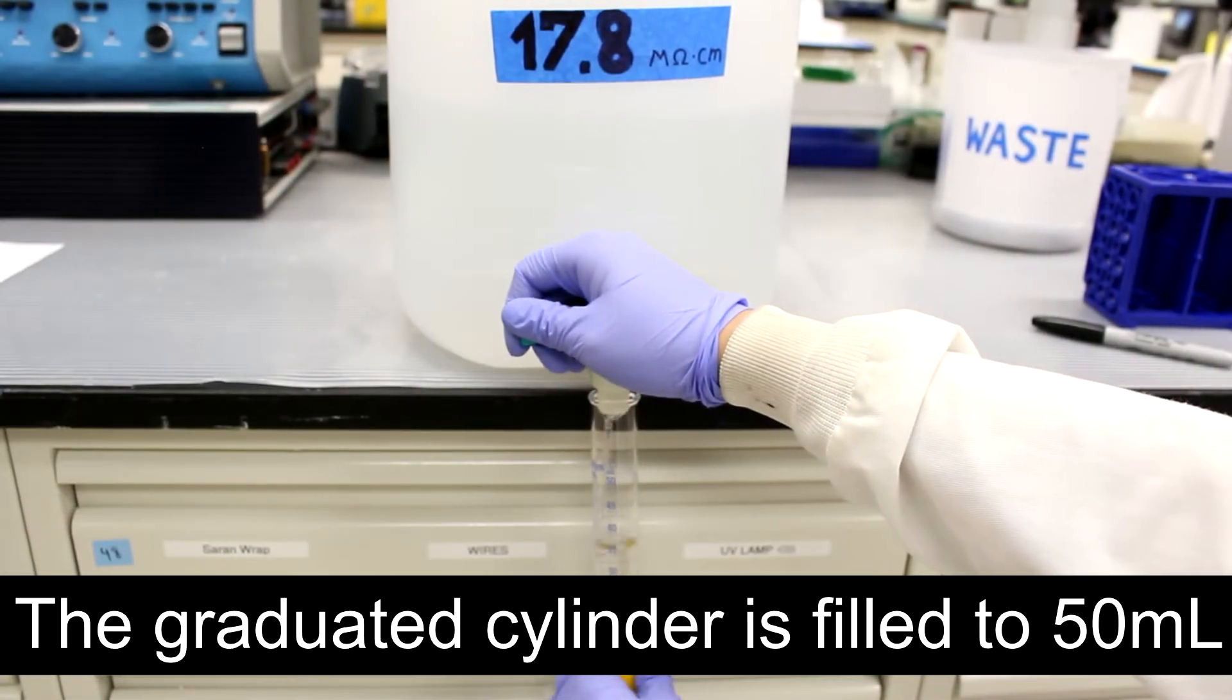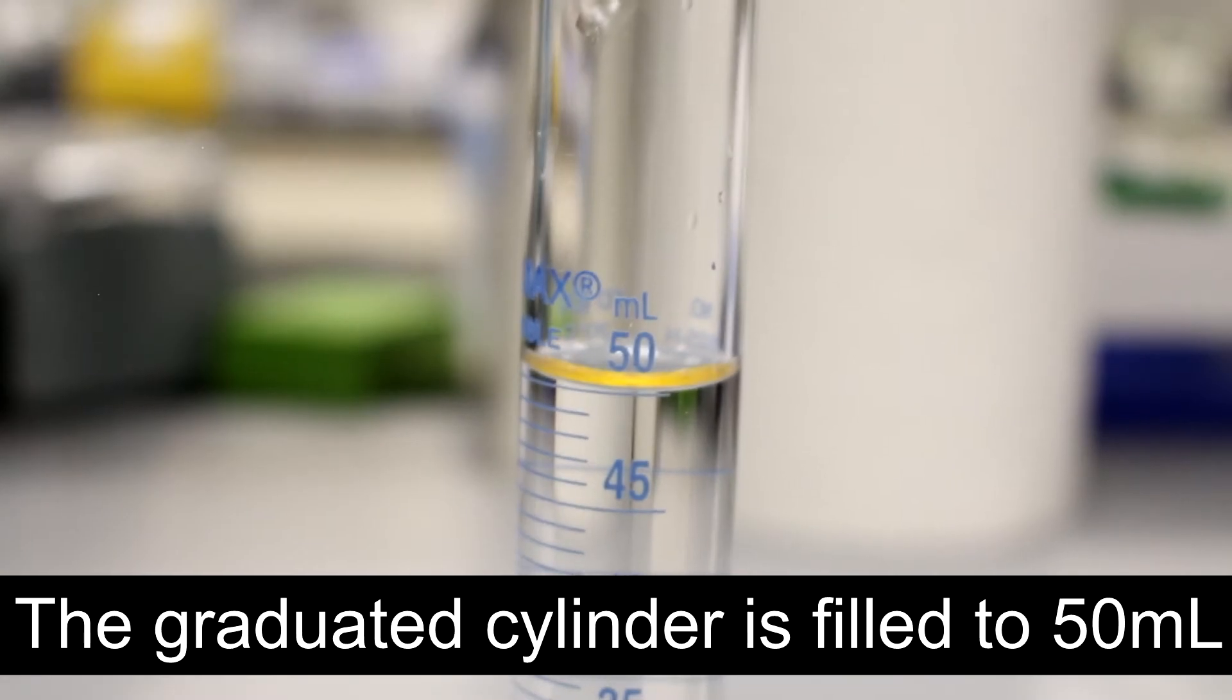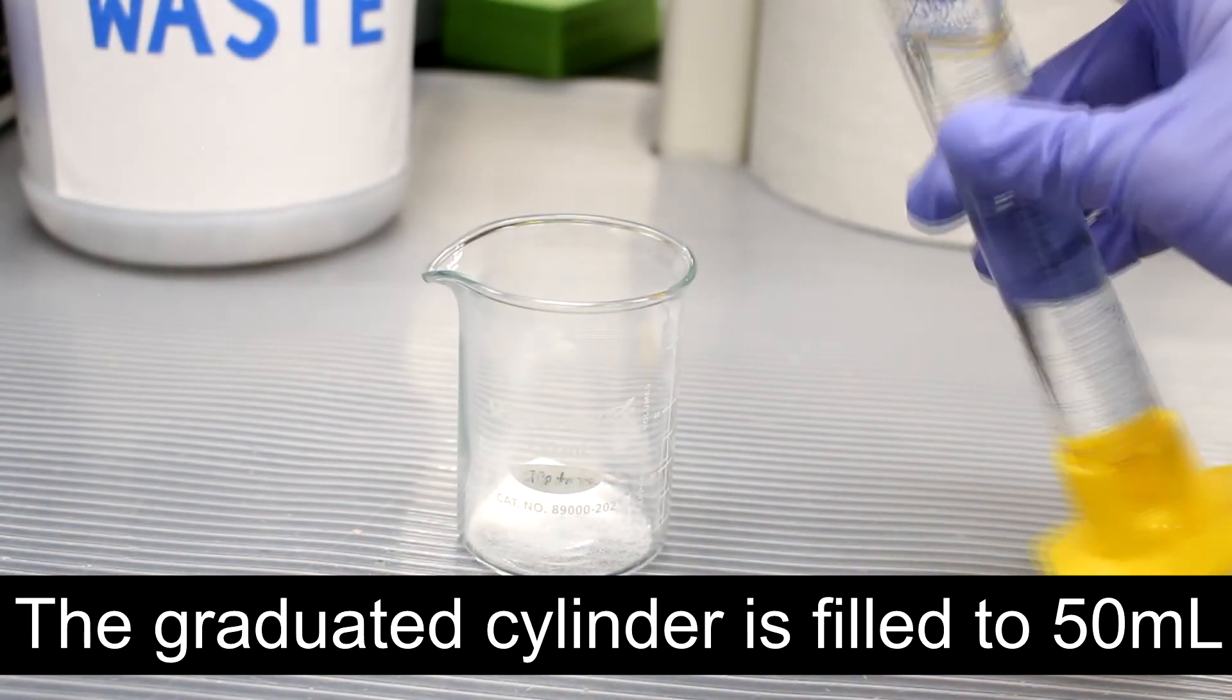The graduated cylinder is then filled to the 50 milliliter mark with ultra-pure water. This solution is then added to the agarose beaker.